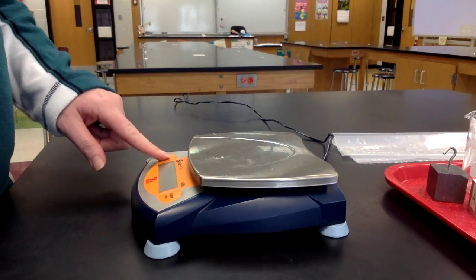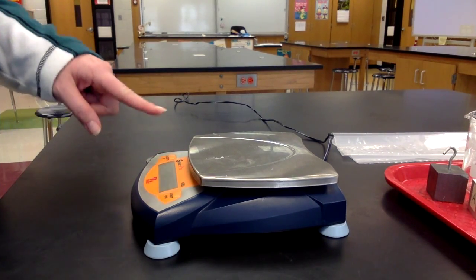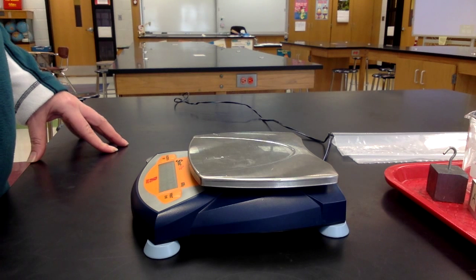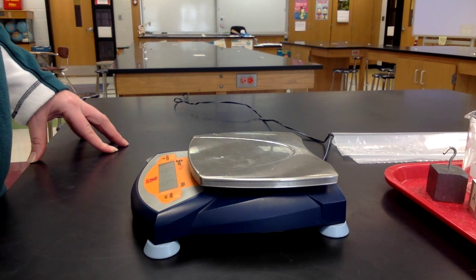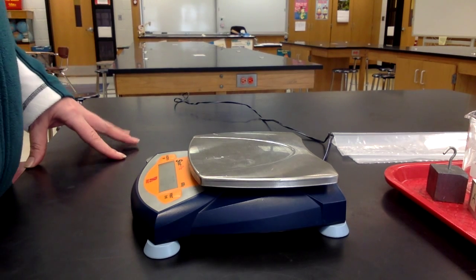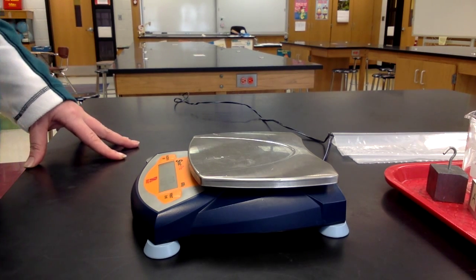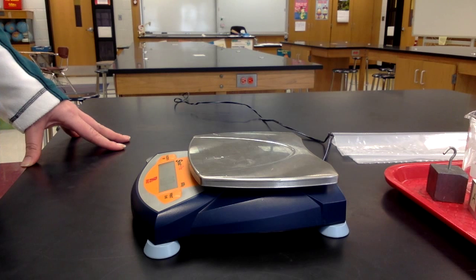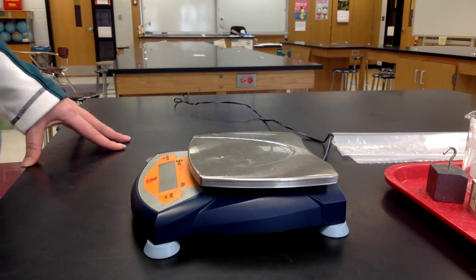Then, press and hold the on button. The scale will have 0.0 and a letter. That letter indicates the unit that you are measuring in.